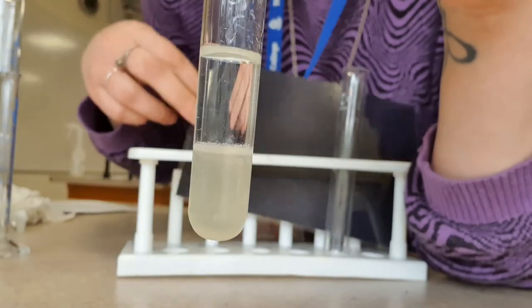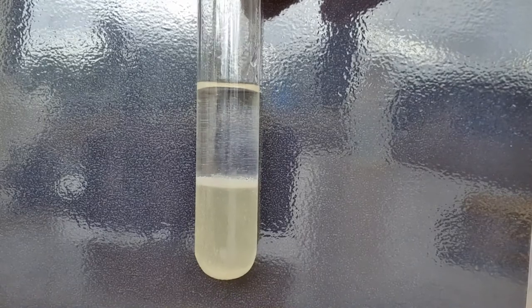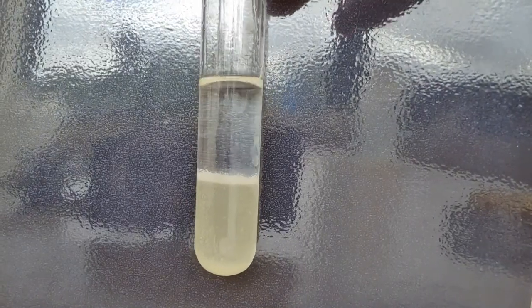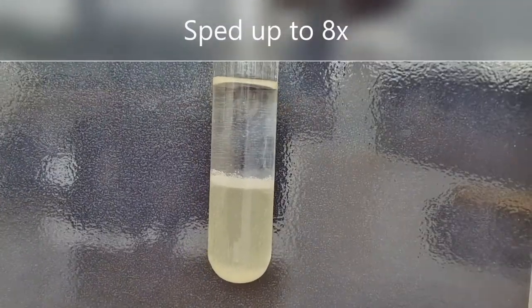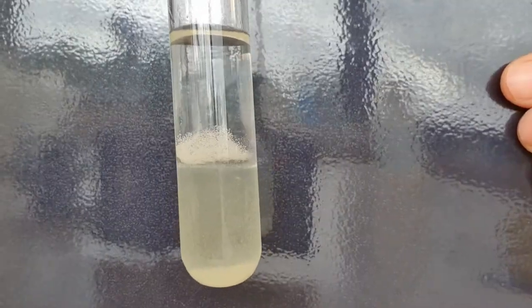Now we're just going to watch this and see if you can see anything forming.